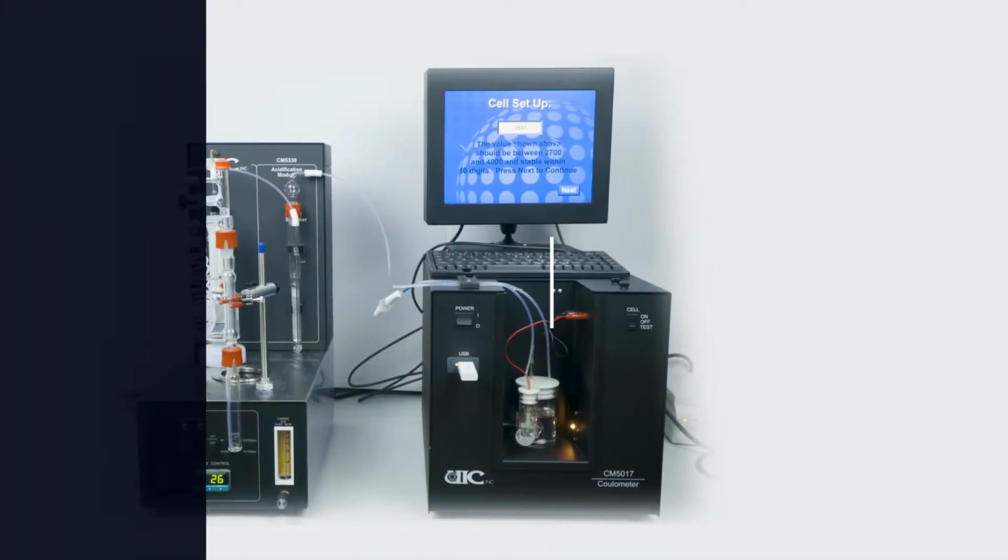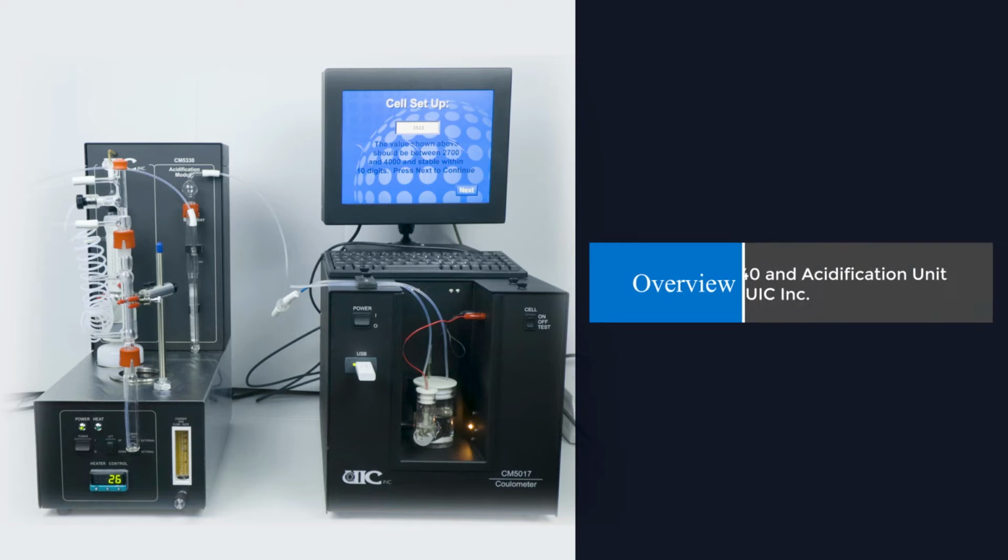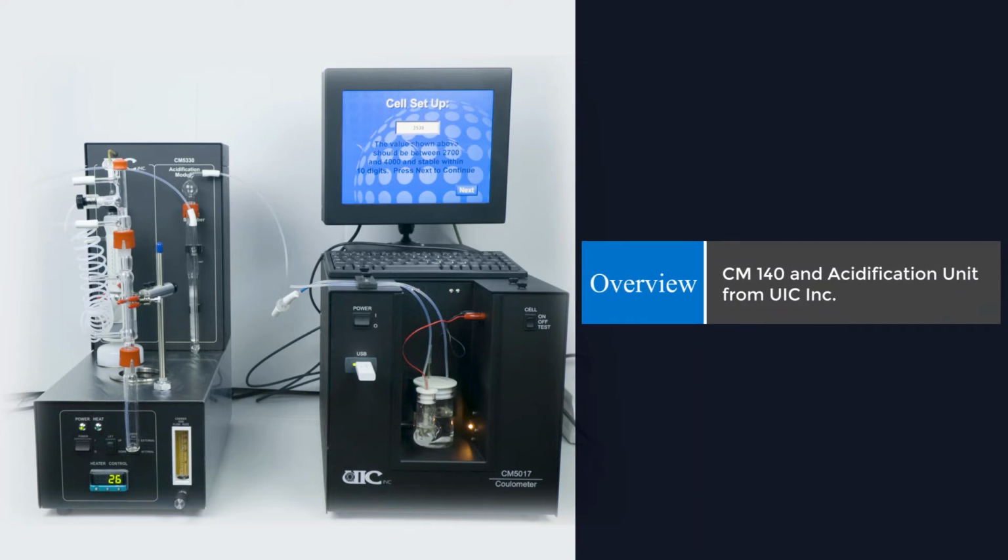Determination of carbon dioxide in amine gas scrubbing solutions. This procedure is typically utilized for the analysis of amine solutions which are used to remove environmentally controlled emissions from flue gases. This method measures the amount of carbon dioxide, CO2, in the scrubbing solution. This result is used along with other analysis to determine the amine scrubbing solution's efficiency and remaining capacity.